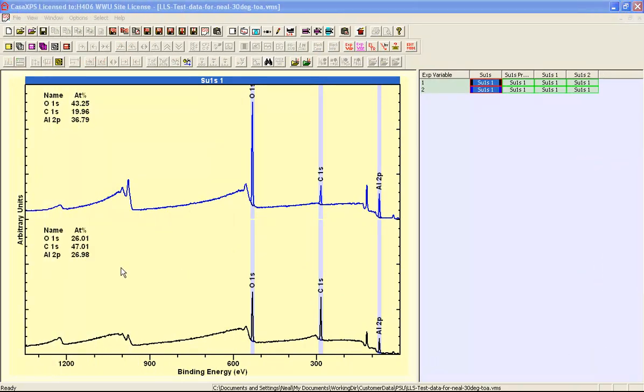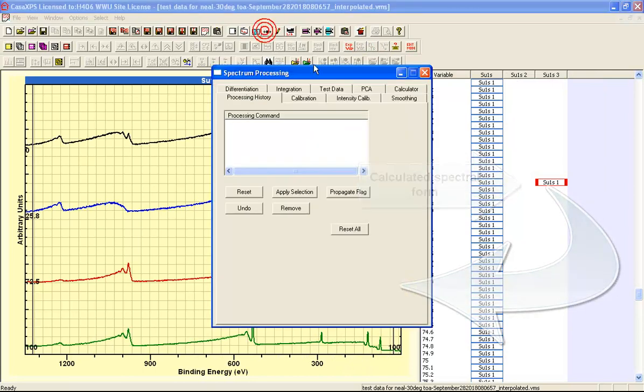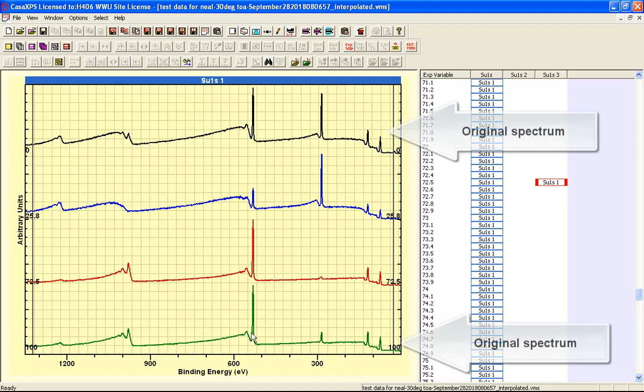Presented with a pair of quantification tables where we have differing amounts of aluminium and oxygen, we'd like to try and understand a little better, in a quantitative sense, how these spectra relate to the idea that we have an overlayer of different thickness. And one way of doing this is to perform a difference calculation. And this was performed using the calculator property page, this difference button here. And it has been applied to the two spectra, and they represent this black trace and this green trace.